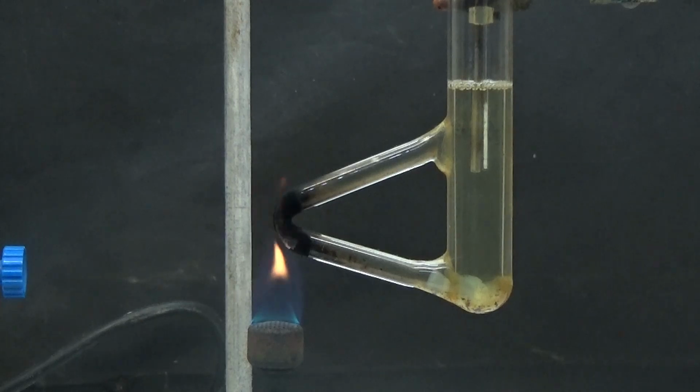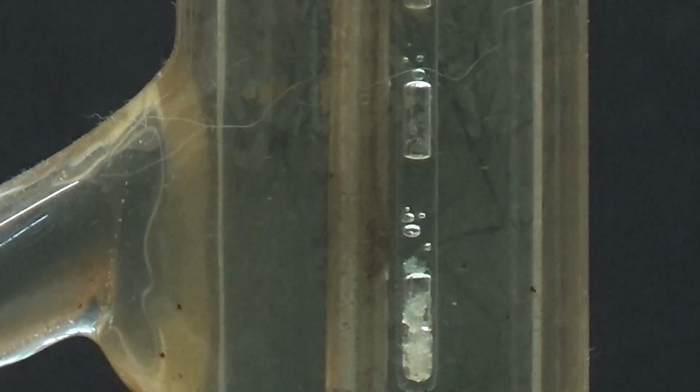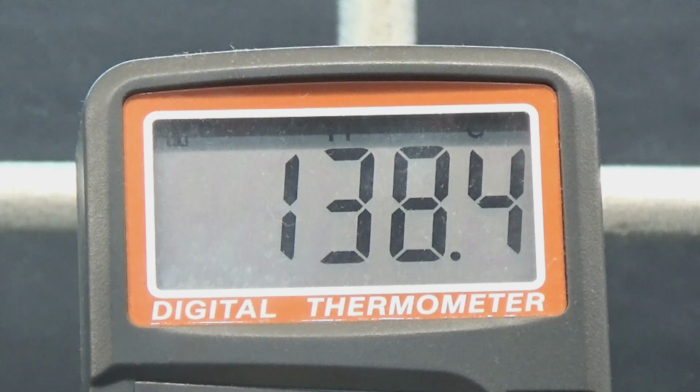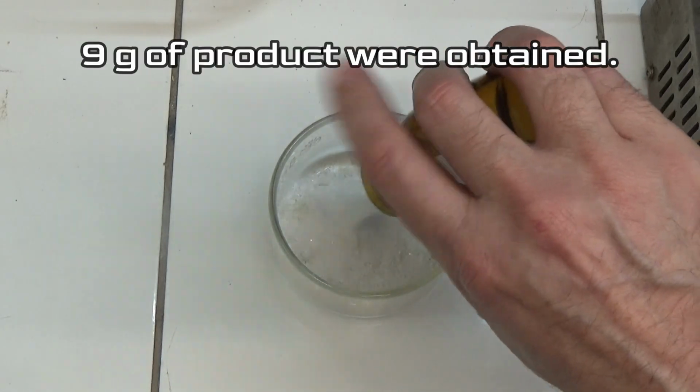Collect the crystals and dry at 40 degrees. The melting point was determined being higher than in the previous assay. In this test the value was 135 to 140 degrees. Much closer to the theoretical melting point of ethyl uridoacetate. In this experiment 9 grams of product were obtained.